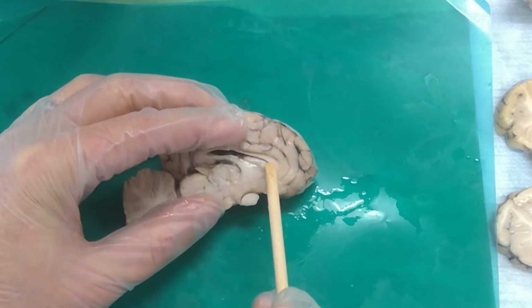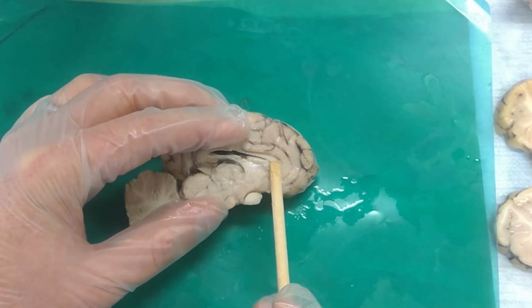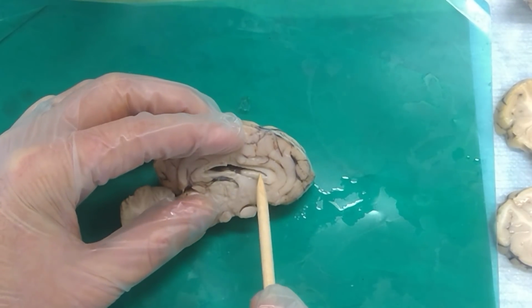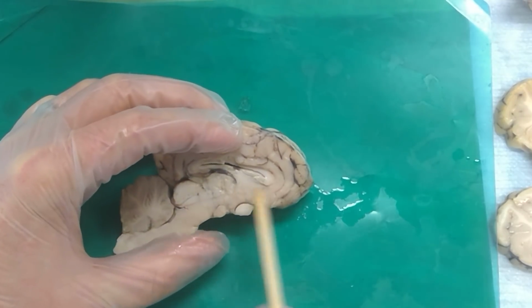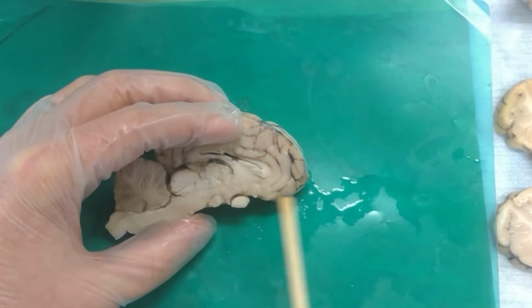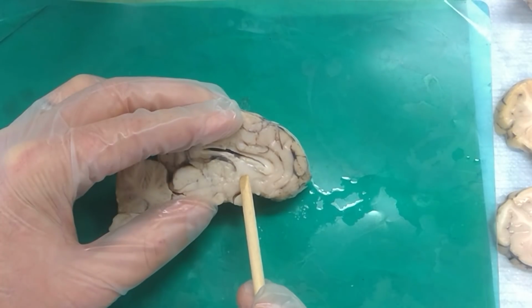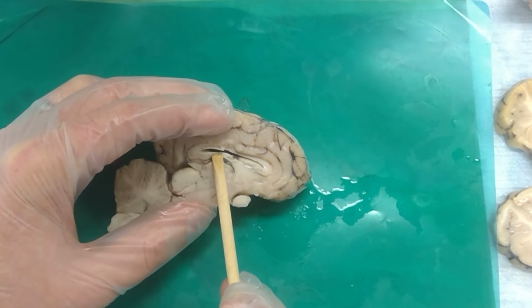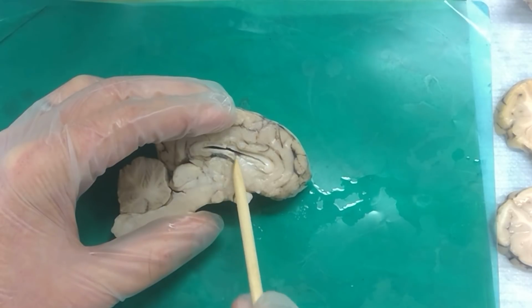Septum. If we had a membrane that was covering the lateral ventricle, what would that be? Right. Since we don't, we can see this nucleus in here, which is the... And then we've got... What is this guy right here? Correct. And if we could see a white dot right here... Correct. And these fibers running down along this way in front of the thalamus? Fornix. This big old round circle right here?